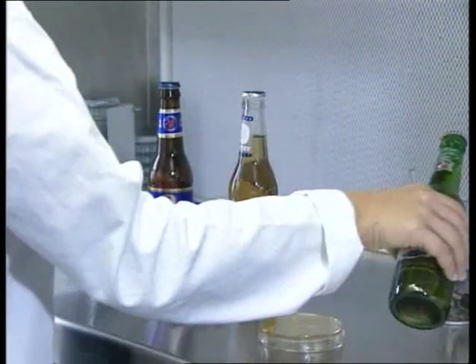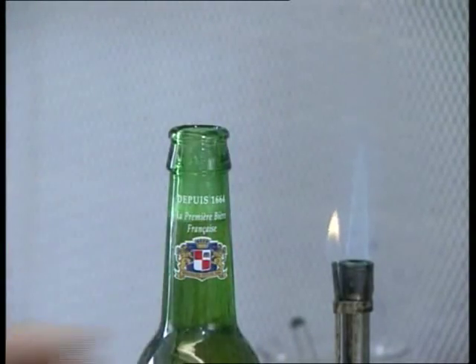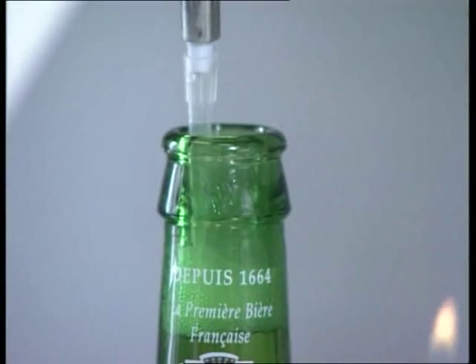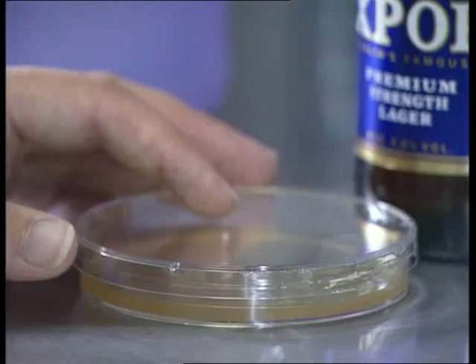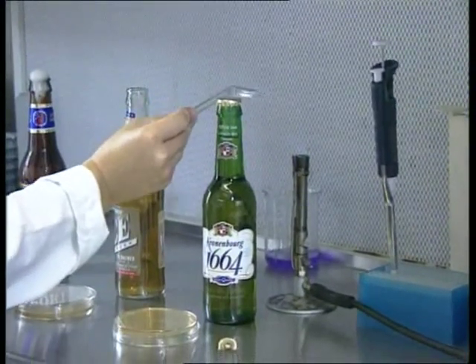Samples collected during brewing and bottling are cultured to detect contaminants. All equipment is sterile and work takes place in a laminar flow cabinet.